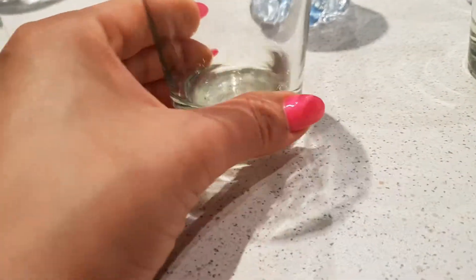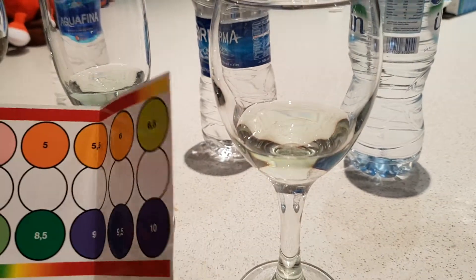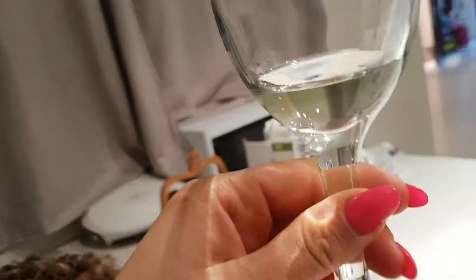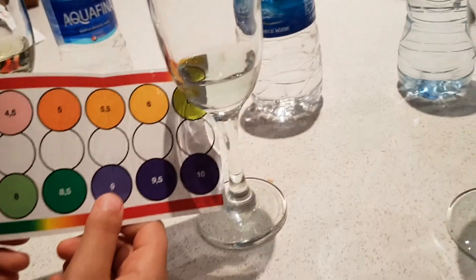Now low pH — Al Ain, 7.5. Surma — that's good. That's blue. That's 8.5, between 9.